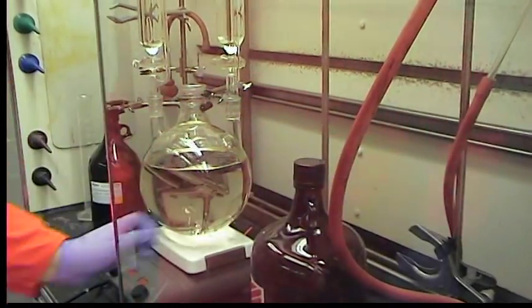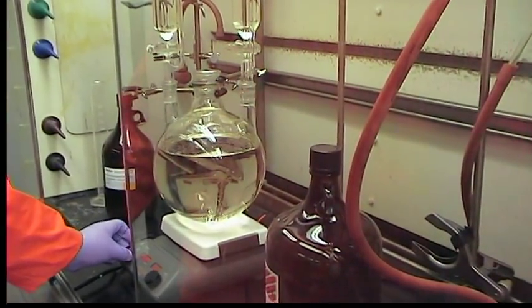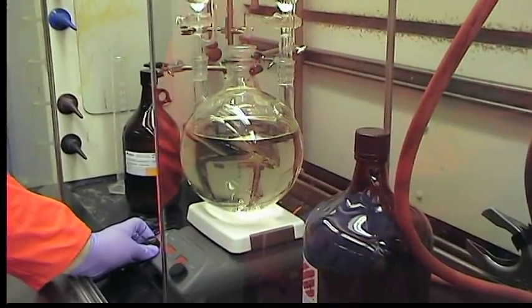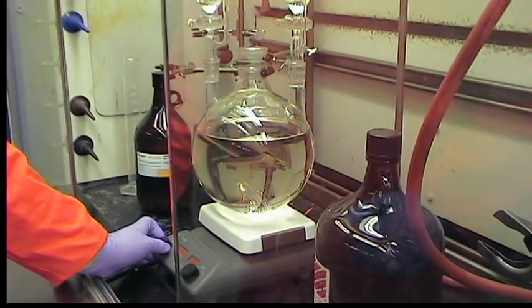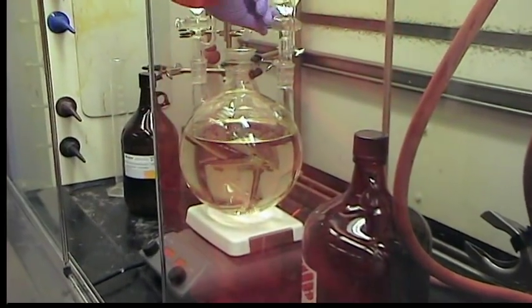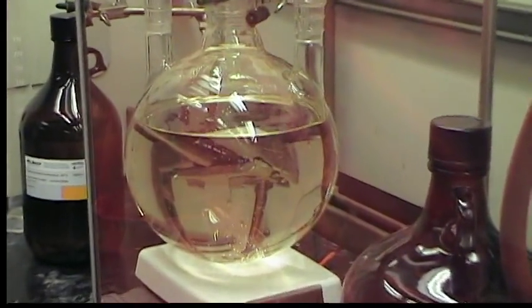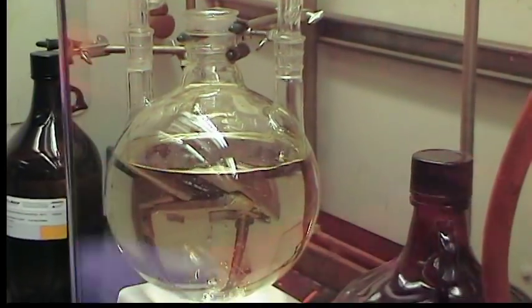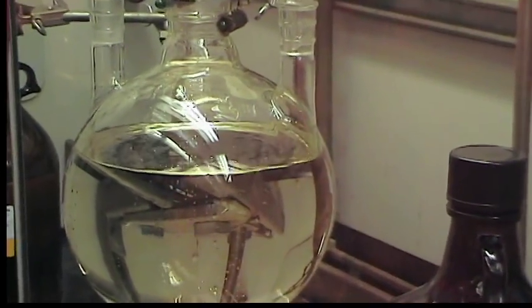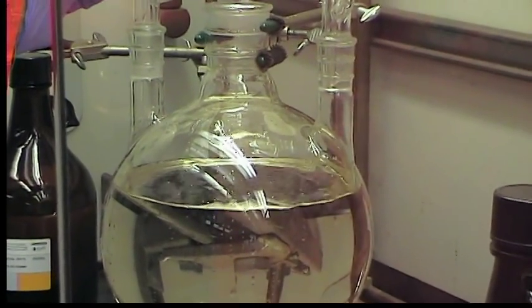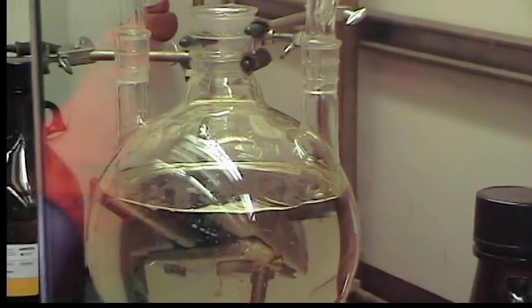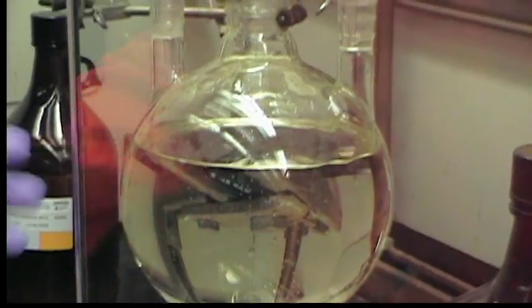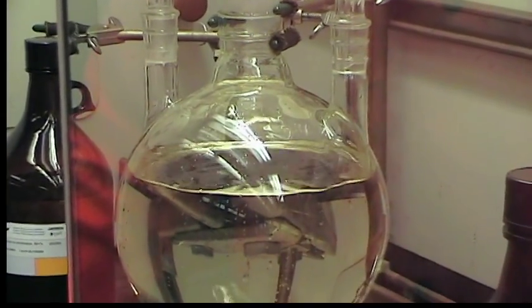Now with the acetic anhydride, we're going to be adding one of the reagents under stirring: the 4-hydroxy-4-methyl-pentanone. Ideally this should be added under stirring over a period of about 5 minutes, during which the temperature might increase a bit. We're going to slowly add this and then come back with adding the other reagent.